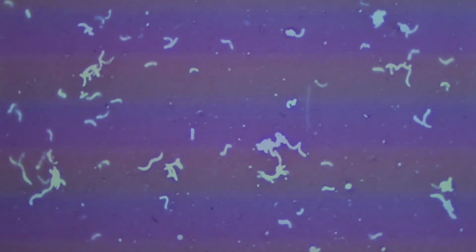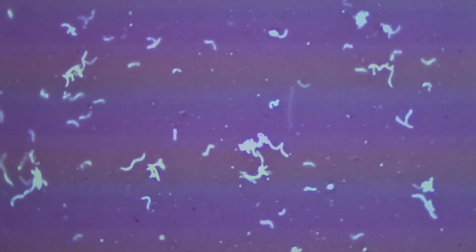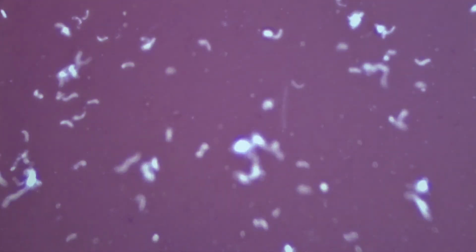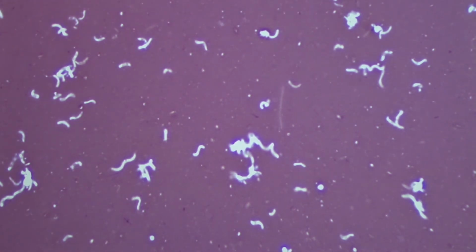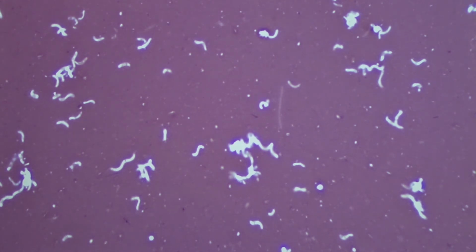Okay, that brings us finally to our simple negative stains. Let's recall with the simple negative stain, we did not in fact heat fix these slides. We simply put a drop of nigrosin on these slides and we smeared it across the edges in order to spread the cells out over the slide. Now, what I'm doing here is I am avoiding the pitch black background of that slide. We use nigrosin to block out the white background. So we are simulating dark field microscopy without needing those special plates and filters under the stage.